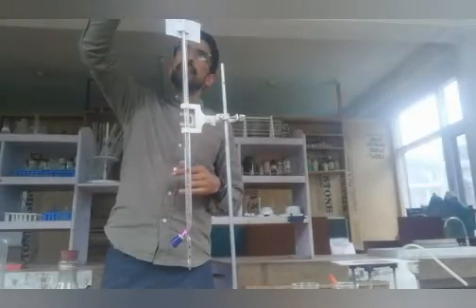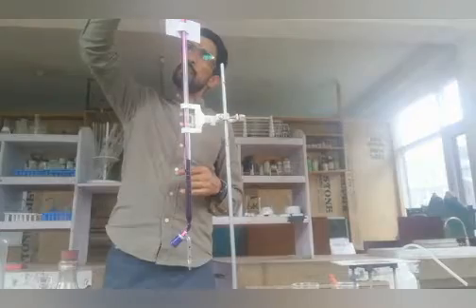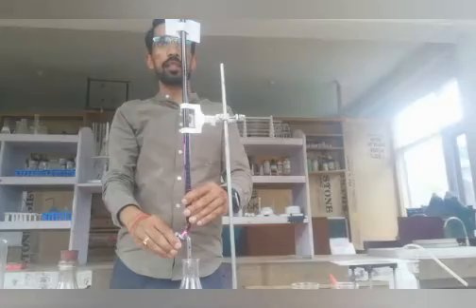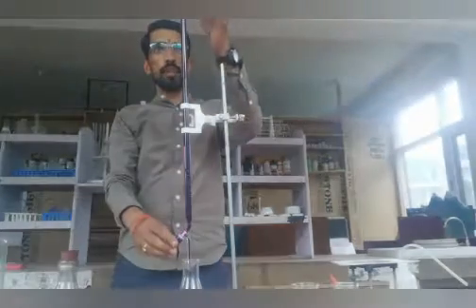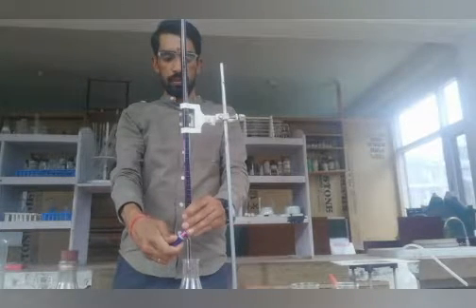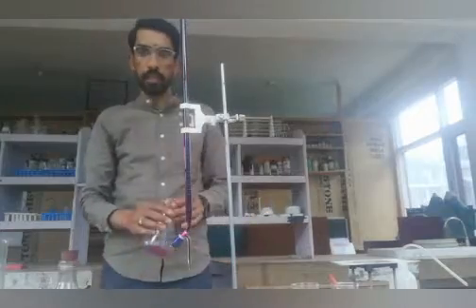Why do we need to rinse first? So that we will get a perfect reading. Once we fill the solution up to zero by looking at the mark, we start the reading from zero. This is our zero point. The rest of the solution we will use for titration.